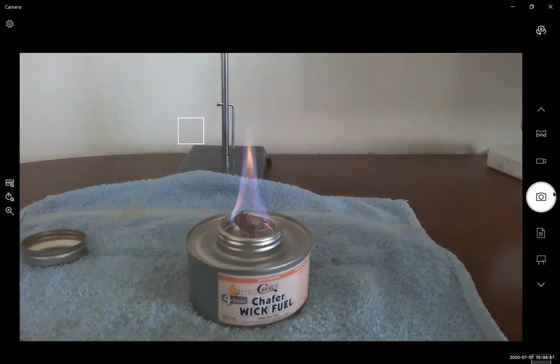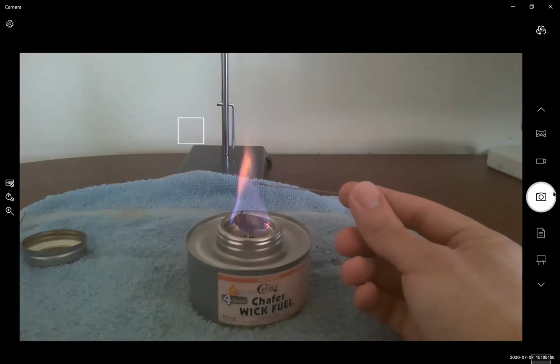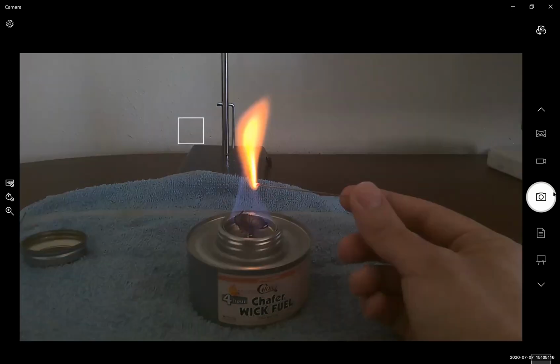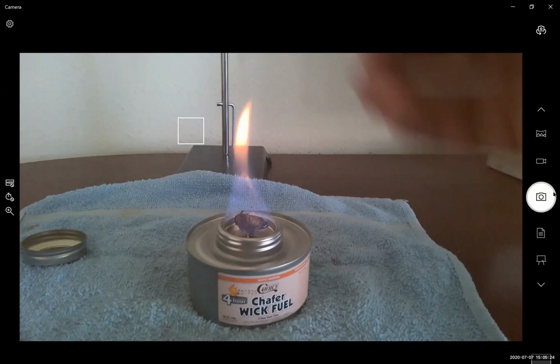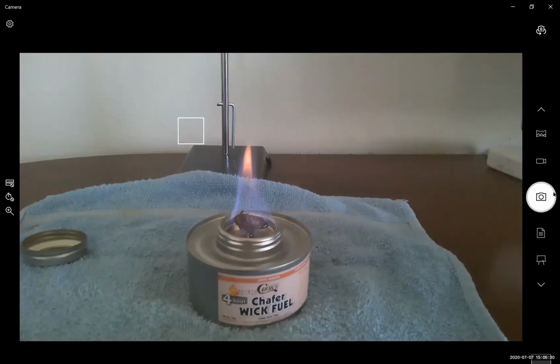Does everyone see how you get this pink? I'll keep doing it just so I find it fun as well. Now, the one thing that you can immediately see is that when you just naturally dip your testing in, you don't see that pink overtone. That pink overtone is coming from our sample. That pink purple overtone, does everyone see that?